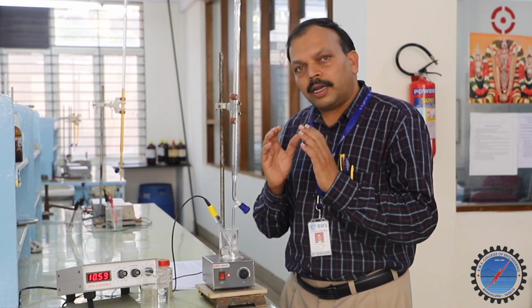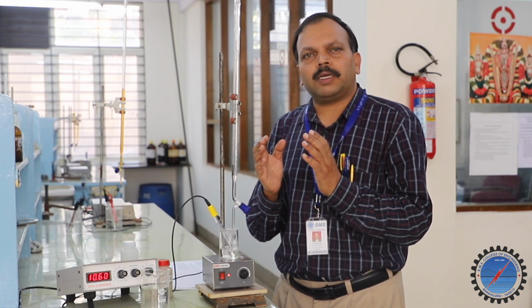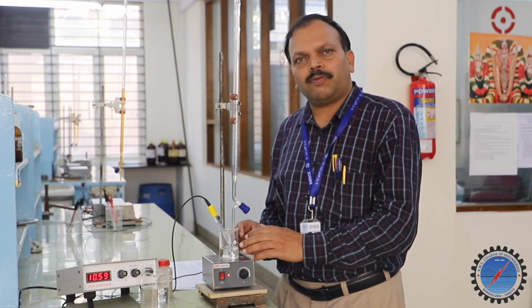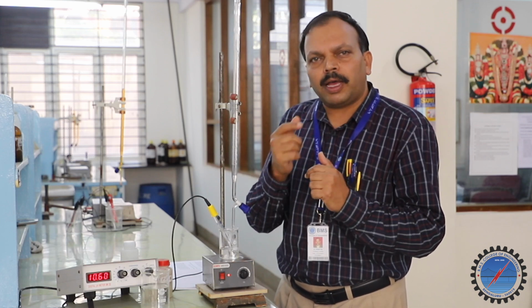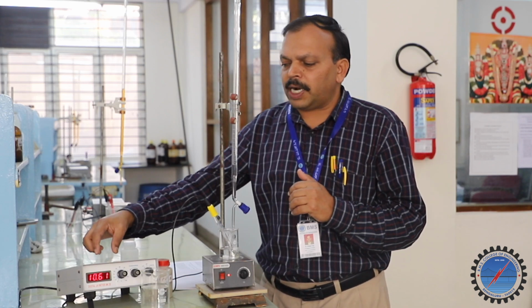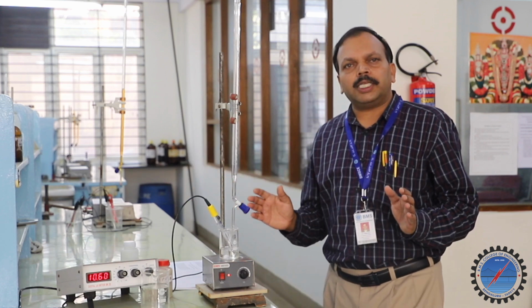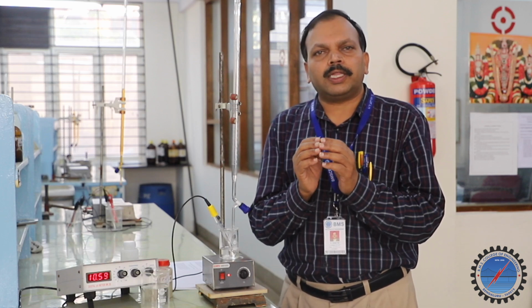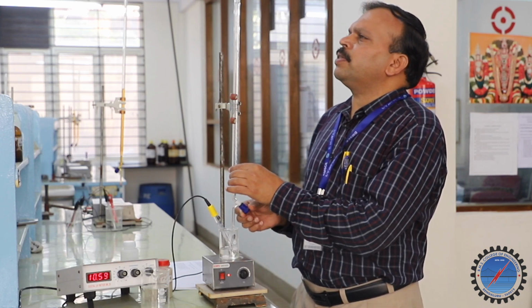Now, why is there a sudden jump in the pH from 6 point something after adding just another 0.5? All the acid present in the weak acid form is completely neutralized by the base added. The further 0.5 ml of base added brings the sudden jump in the pH from 6 point something to 10. We are not supposed to stop at this stage when we get the jump. We have to further increase by another 0.5, 3 to 4 times, in order to complete our graph which we are going to plot. So, I am going to continue with another 0.5, 3 to 4 times.